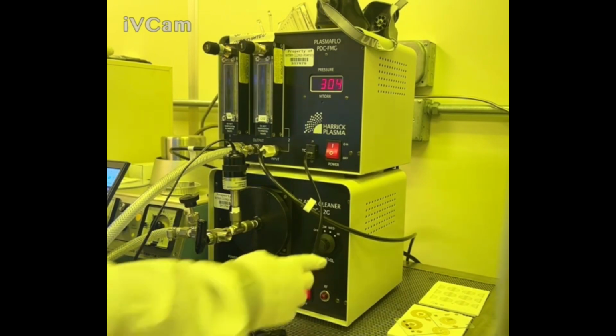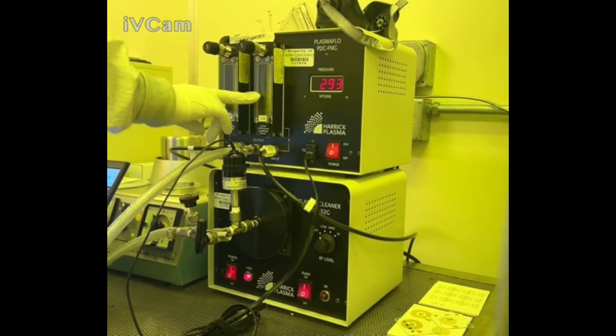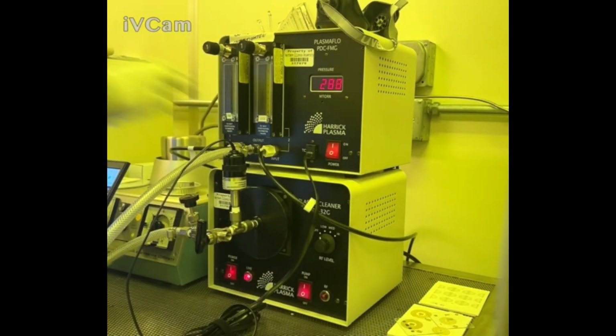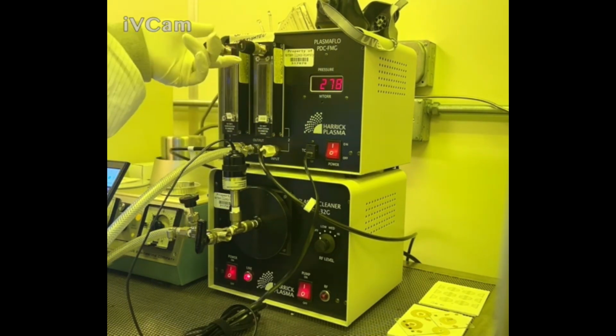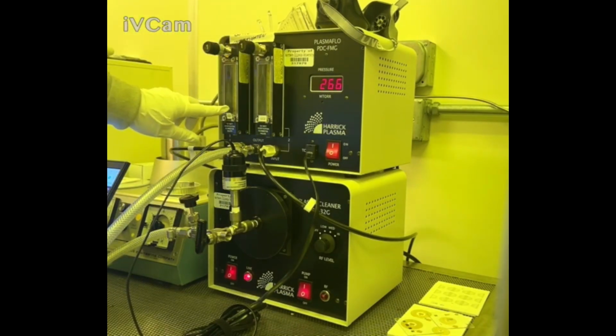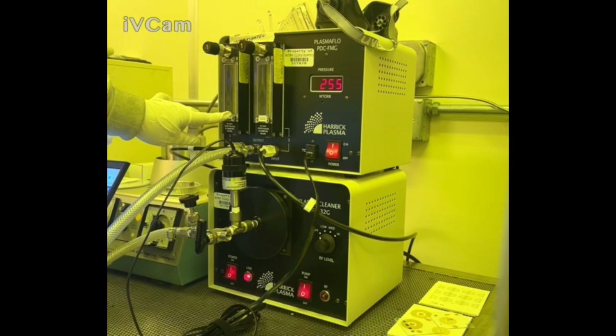Make sure that this is on the off. Don't turn this on yet. And then make sure that these two valves are completely at 0. This one is a CO2 valve, and this one is an O2 valve. Turning it right closes the valves, turning it left opens up the valves. There are 2 small black spheres inside of the chambers here that tell you exactly what level of gas is going into the chamber.